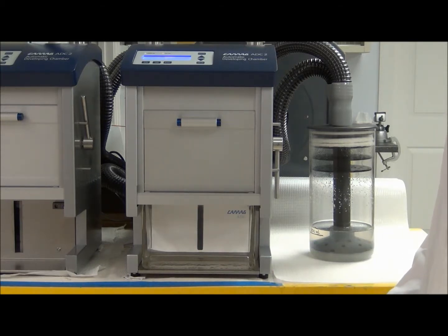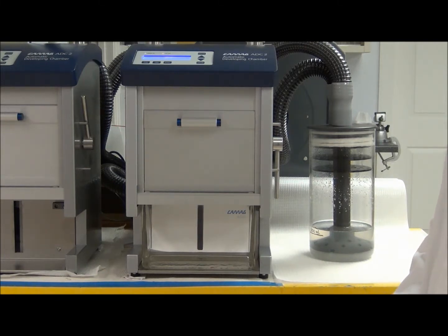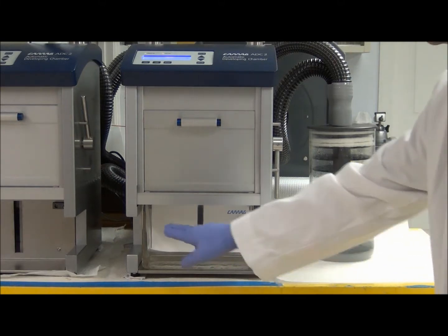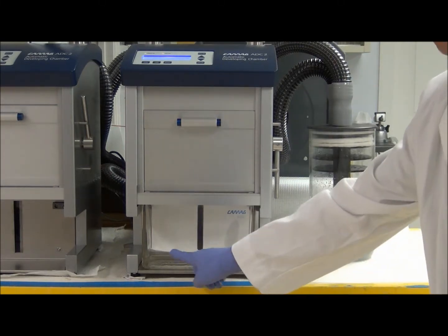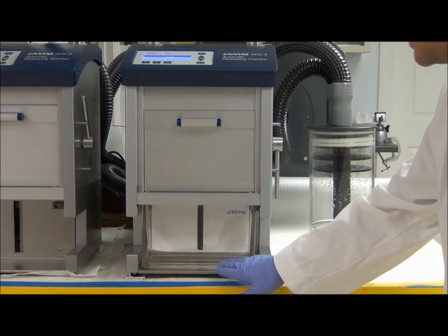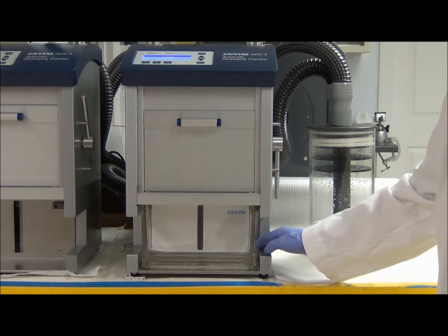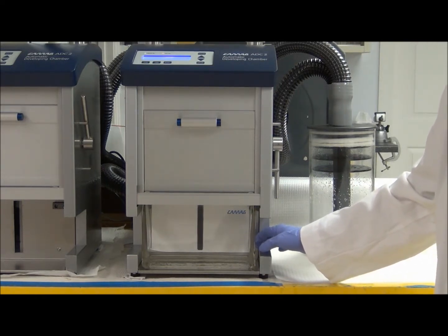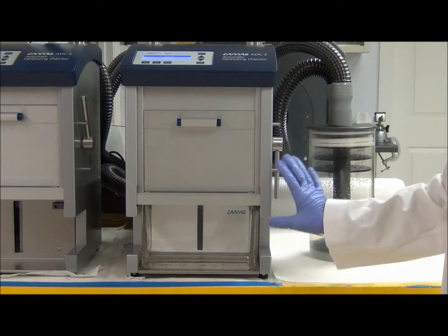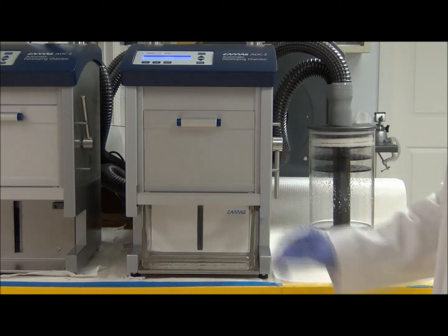That goes on for 30 seconds, and then after the pre-dry the saturation of the chamber will begin. The solvent will actually flow down into the tank — and there we go, you can see solvent flowing into both chambers or troughs of the twin trough chamber. The front chamber contains 10 milliliters of solvent, and the rear chamber where the saturation pad is located contains 25 milliliters of saturation solvent, which in this case is the same solvent. That happens for 30 seconds as the inlet is open and it drains into the tank, and now the saturation process has begun.